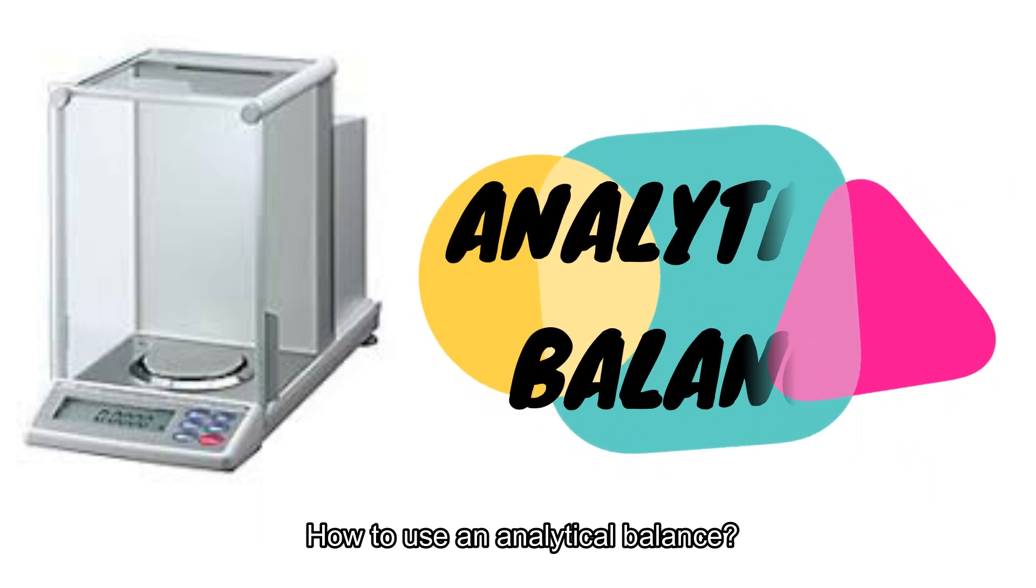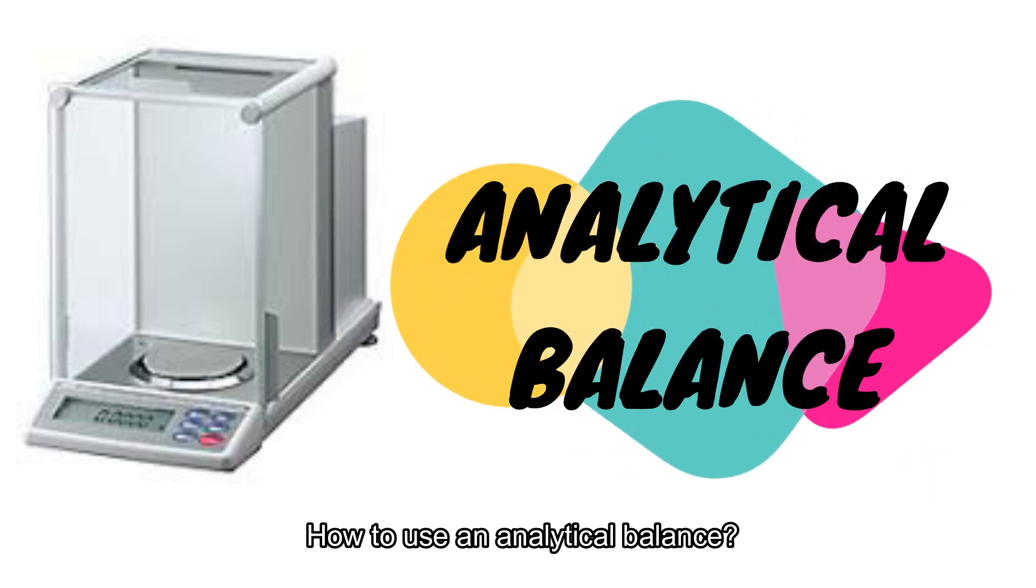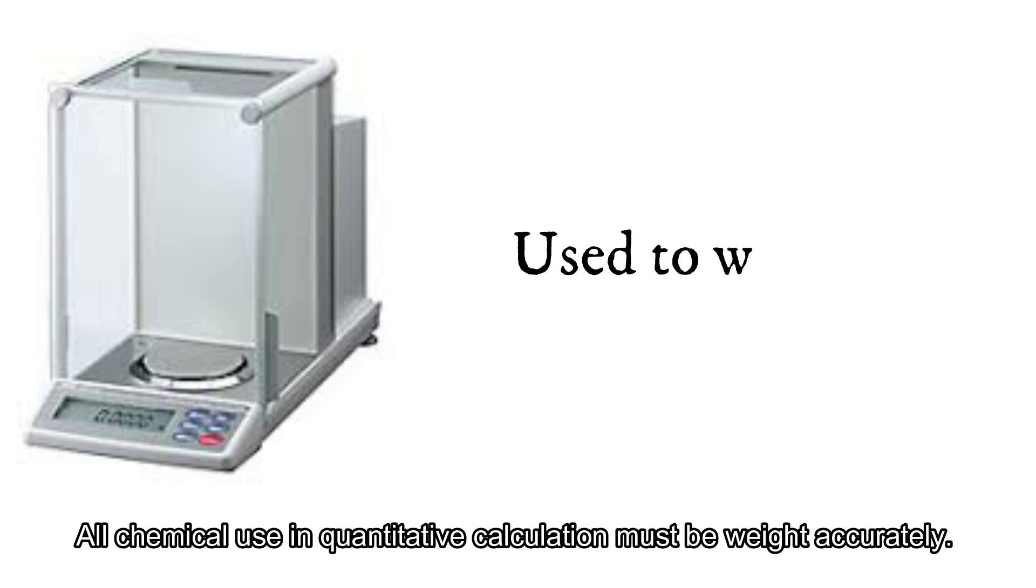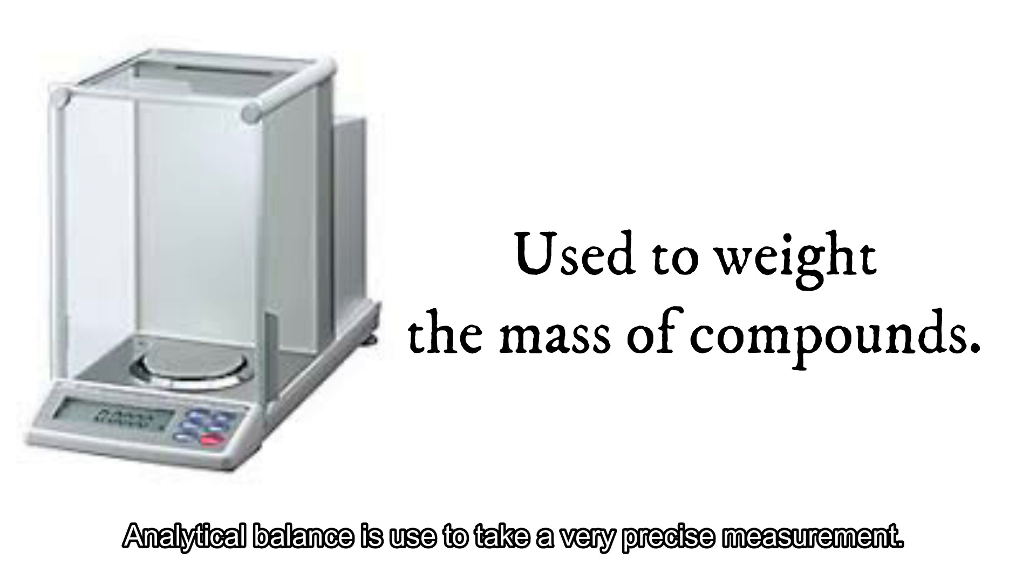How to Use an Analytical Balance. All chemicals used in quantitative calculations must be weighed accurately. Analytical Balance is used to take a very precise measurement.